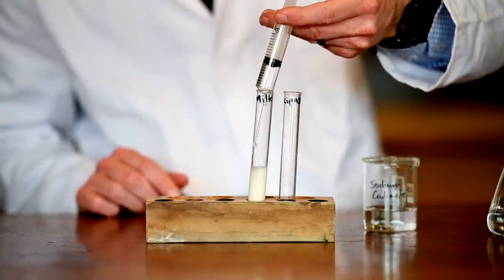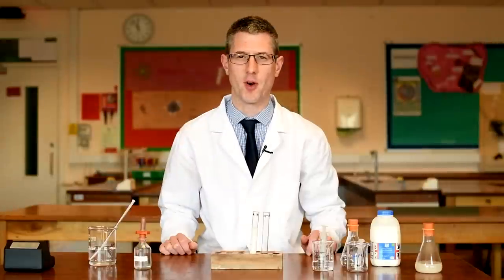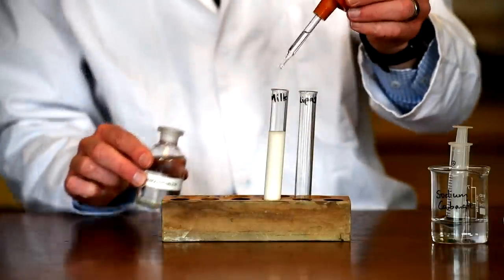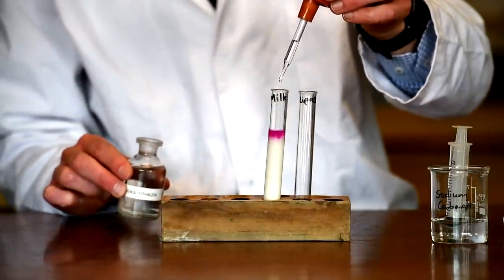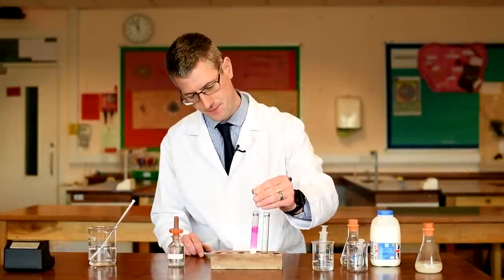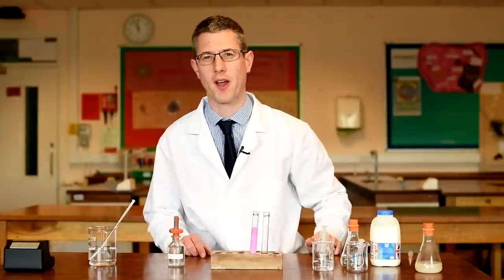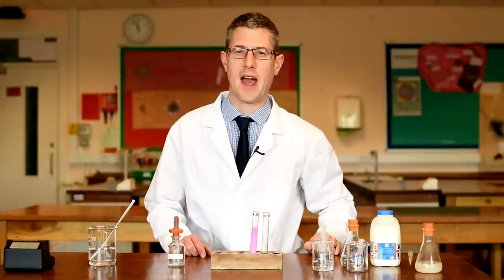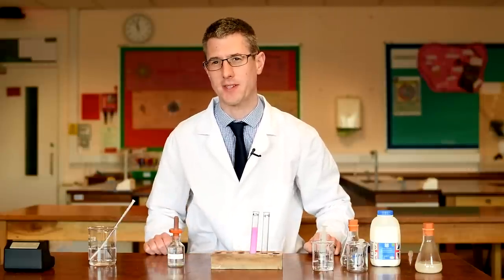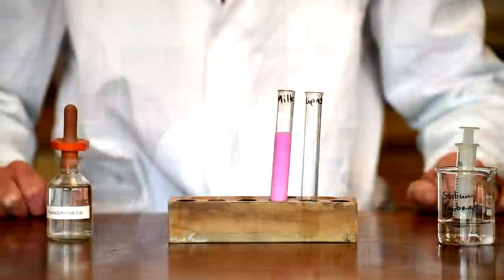Then we're going to add a few drops of an indicator called phenolphthalein. It produces a lovely colour. I've added 5 drops of phenolphthalein and given it a good mix — you can see we've got this lovely pink colour. Phenolphthalein produces a pinky-purple colour when it's in an alkaline solution, or a solution with a pH greater than 8.3. Because I've just added sodium carbonate to this milk, this solution is indeed greater than pH 8.3, so we have this pinky-purple colour.